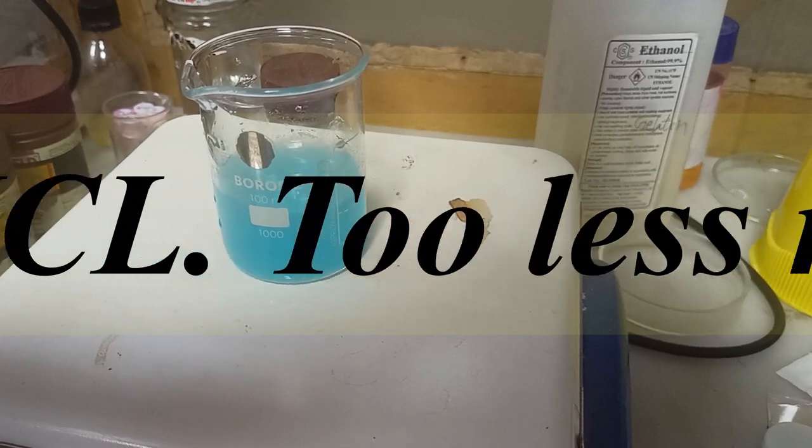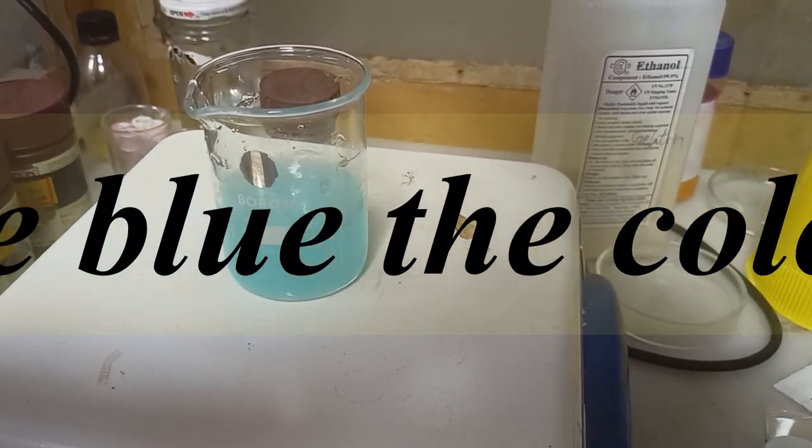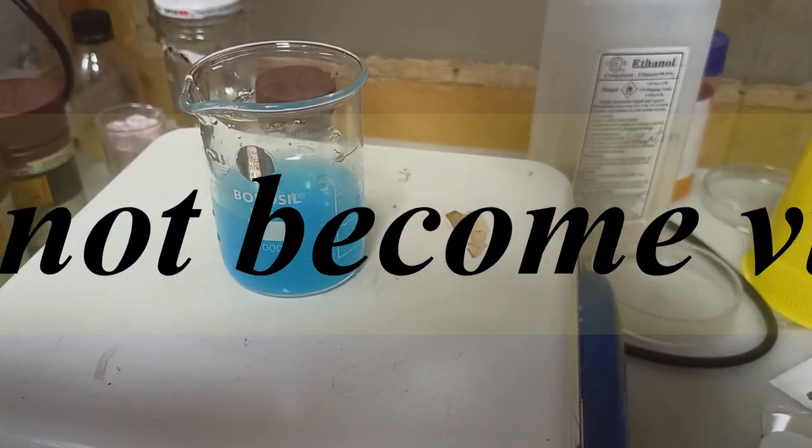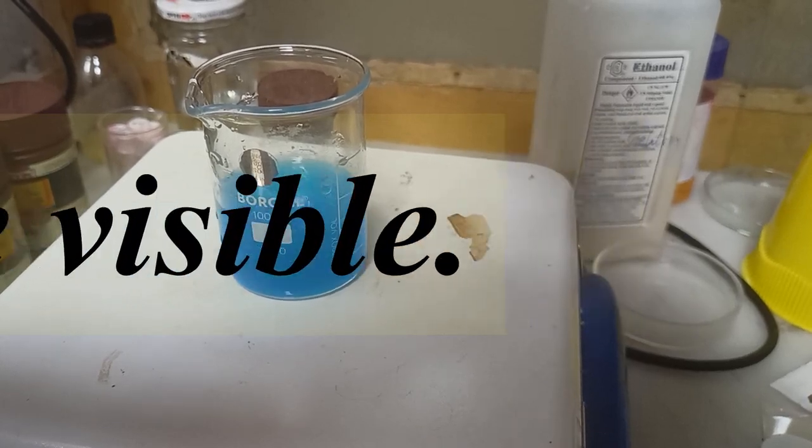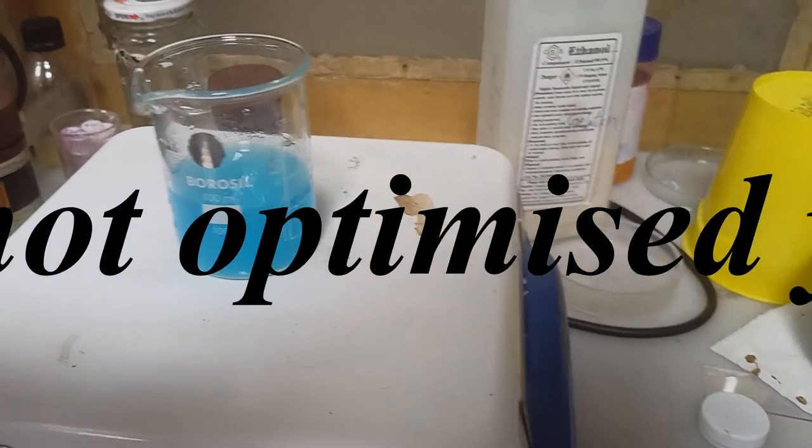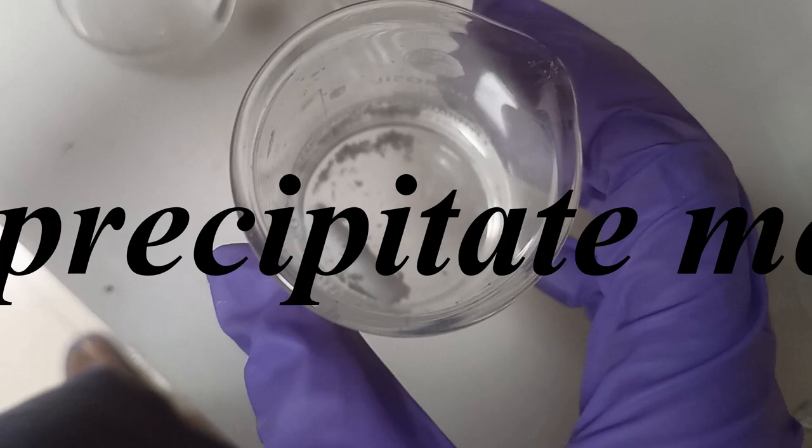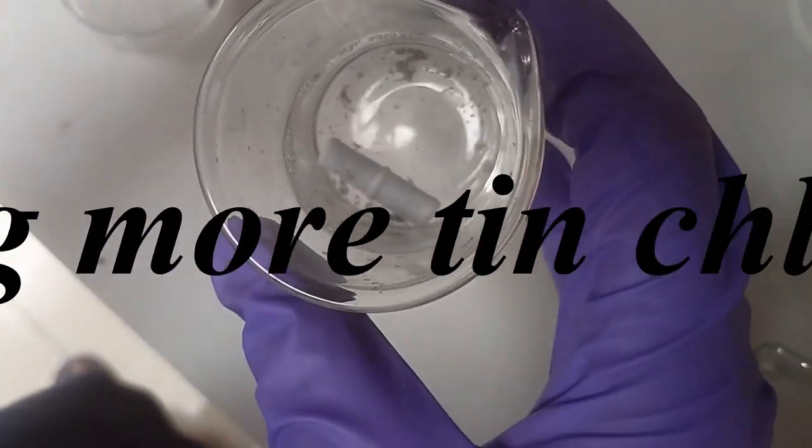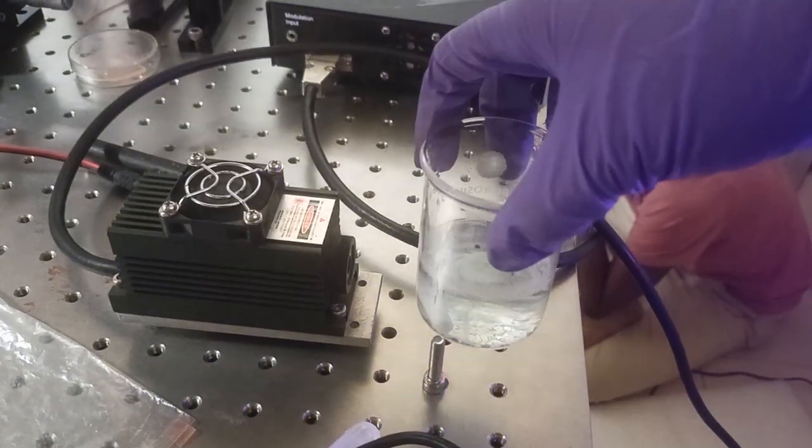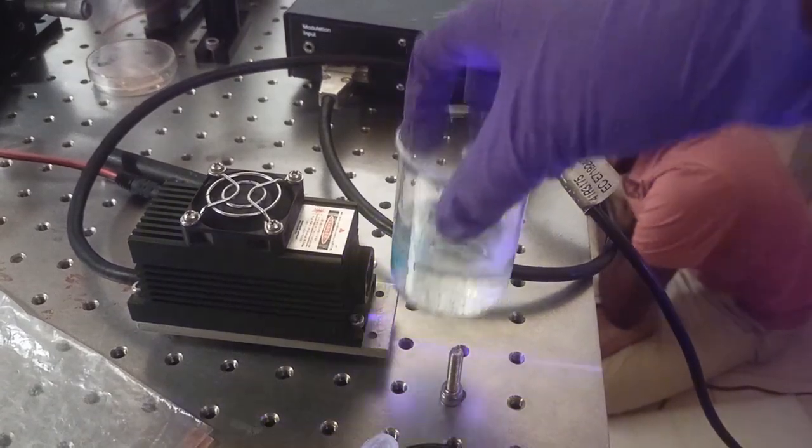Add couple of drops. So here we have a 405 nanometer laser. Here is my liquid. Let us see if the color changes or not.